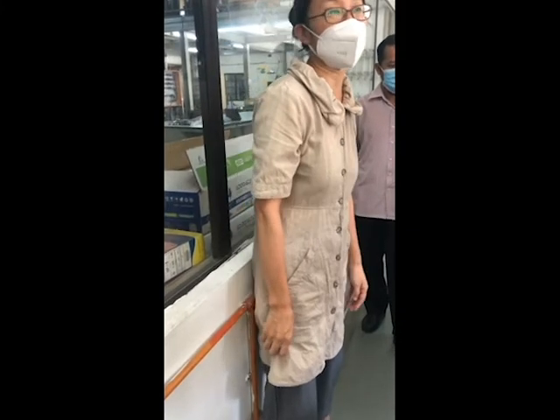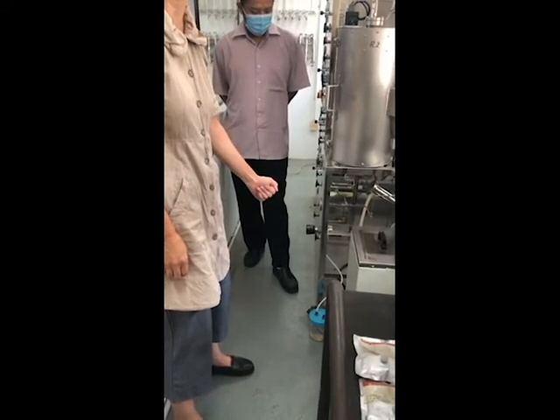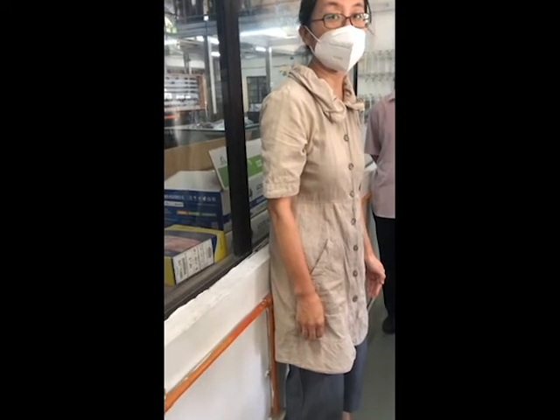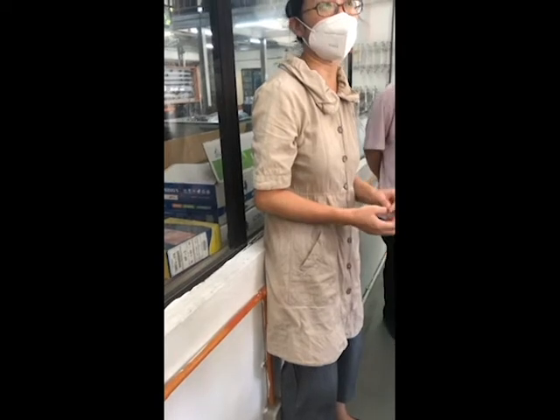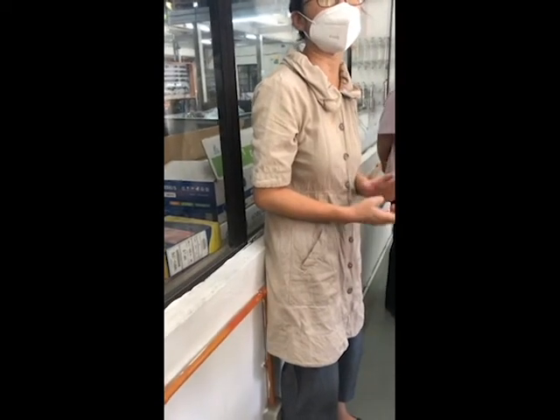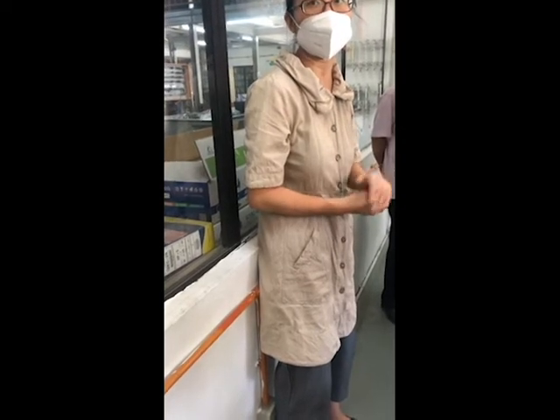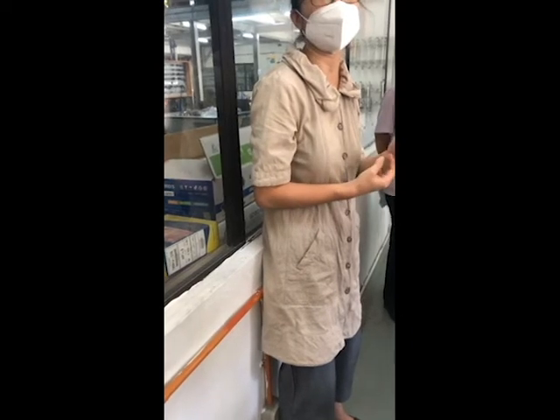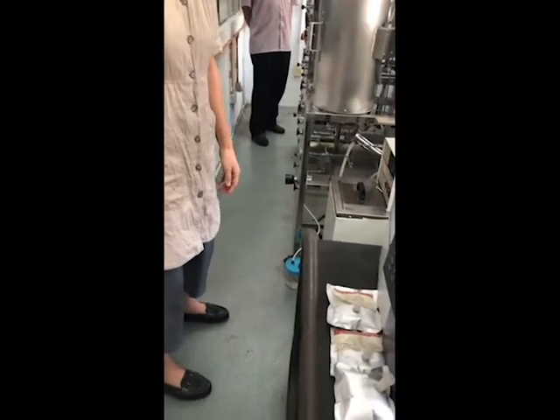If you use any treatment after finishing the reaction, you need to be careful. For example, if your product comes from methane decomposition, the final product is carbon and hydrogen, so the mixture is methane and hydrogen. I think in that case you can use sulfuric acid as the dryer.